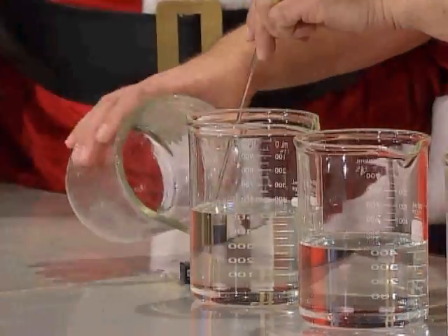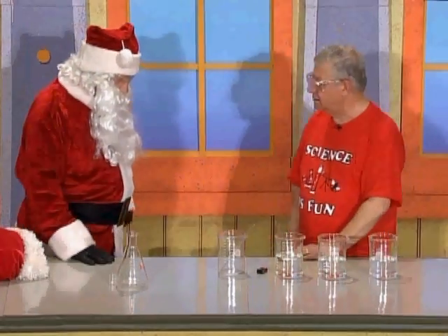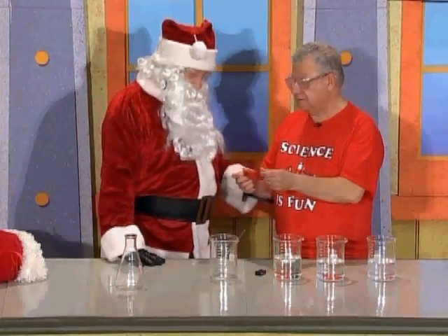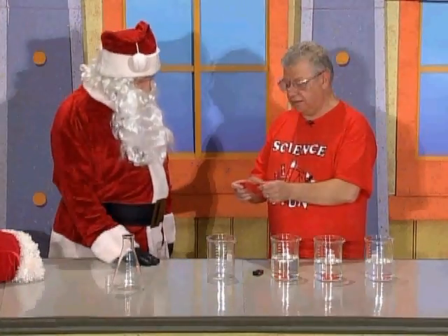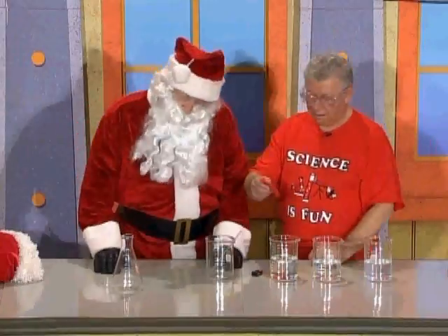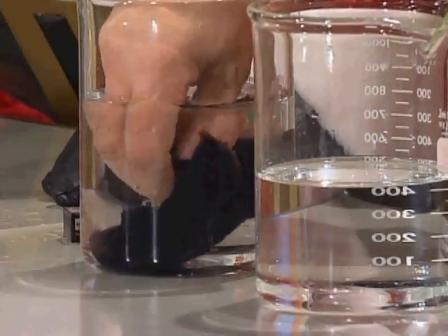Here's your battery back — it's sitting right here. But you know what? The blue is still there, but it's hiding. It's hiding in there. And you know what? You said this is your favorite color. It's my favorite color too. So I'm going to use this to soak the blue color out of there. Okay, you ready? I'm ready!